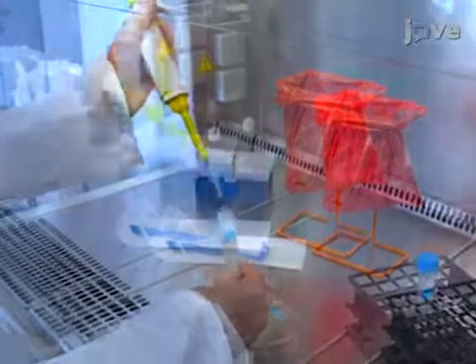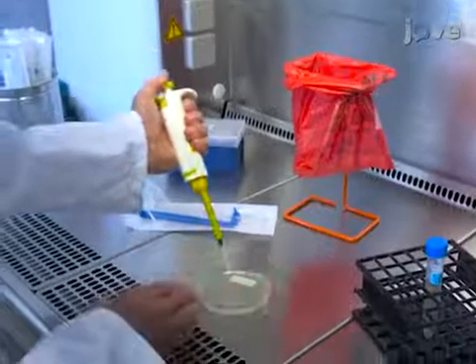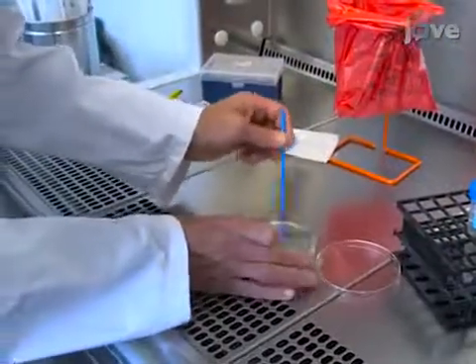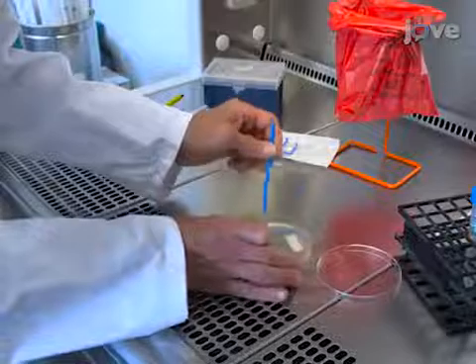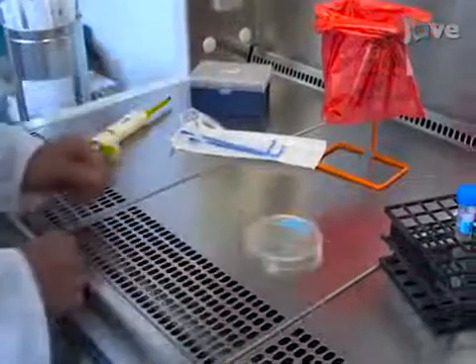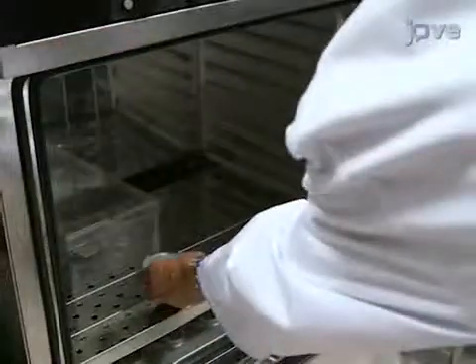To begin this procedure, prepare a lawn of the bacteria by spreading 100 microliters of an overnight culture of the strain, incubated at 30 degrees Celsius in LB, over the surface of a plate of LB agar medium. Incubate the plate overnight at 30 degrees Celsius.